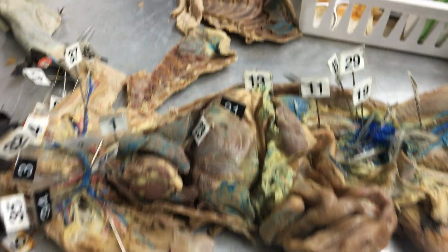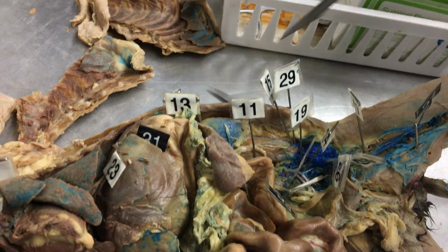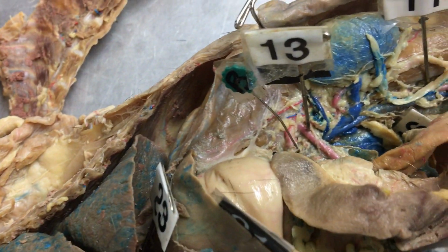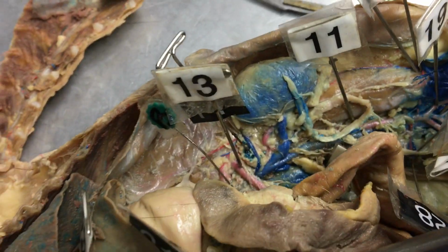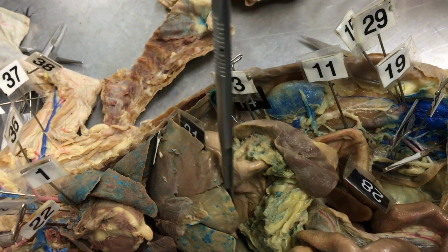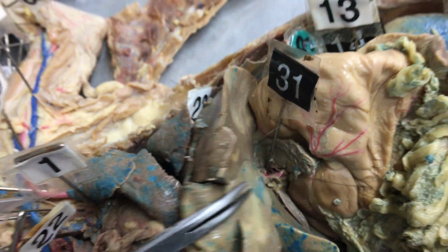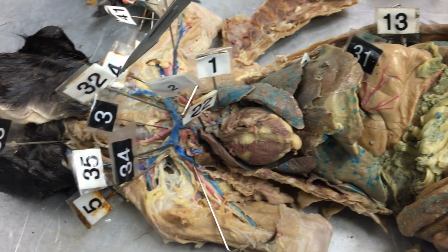And then 29 is the ovarian or testicular. It's really too small to see on this cat. 30 is going to be up here. And it is the suprarenal, and it's that pin without anything in it. And 31 is also deep underneath here, and it's hepatic vein. Really hard to see without cutting apart the liver. And then we go back up here.